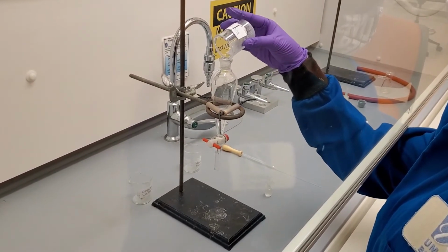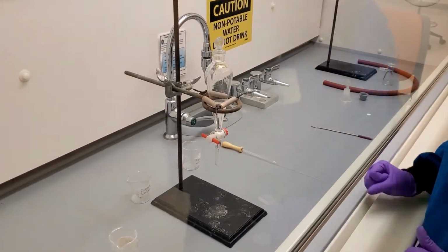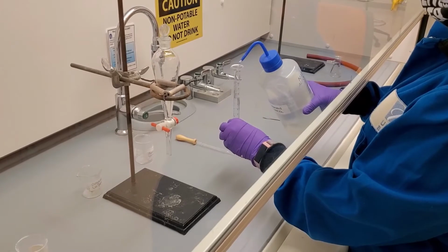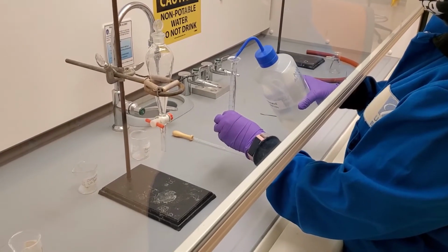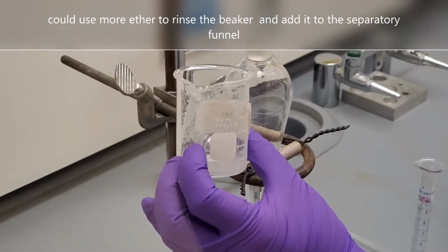Because ether evaporates very quickly, we will stopper the funnel while we measure out the 10 milliliters of aqueous bicarb solution. Notice that while we were measuring out the bicarb solution, the remaining ether in the beaker evaporated, leaving a thin film of mixture. In order to maintain a good yield, more ether could have been used to rinse the beaker and then added to the separatory funnel.